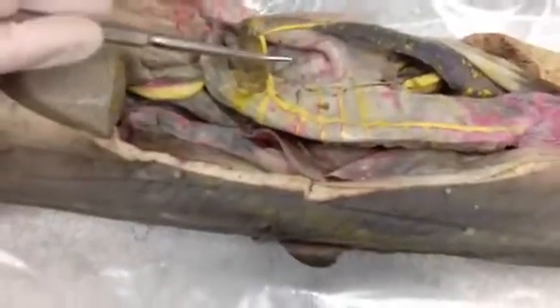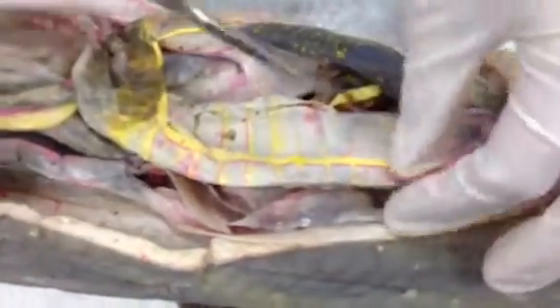All of these are the peritoneal organs and they're covered in serosa. The parietal serosa — also called parietal peritoneum — is the serosa that lines the cavity. The visceral serosa, or visceral peritoneum, is what covers all of the organs.